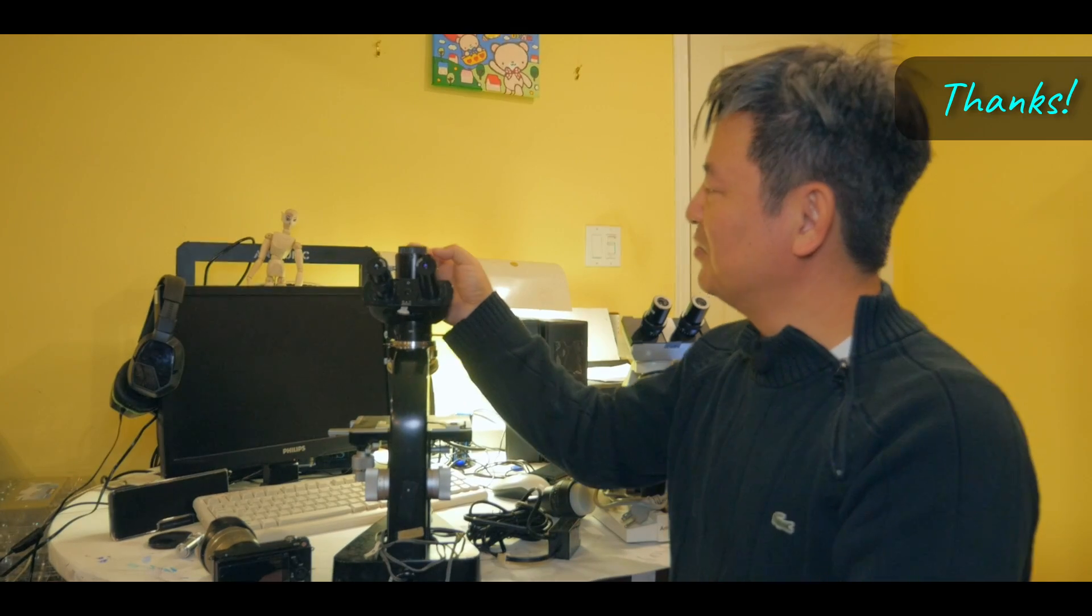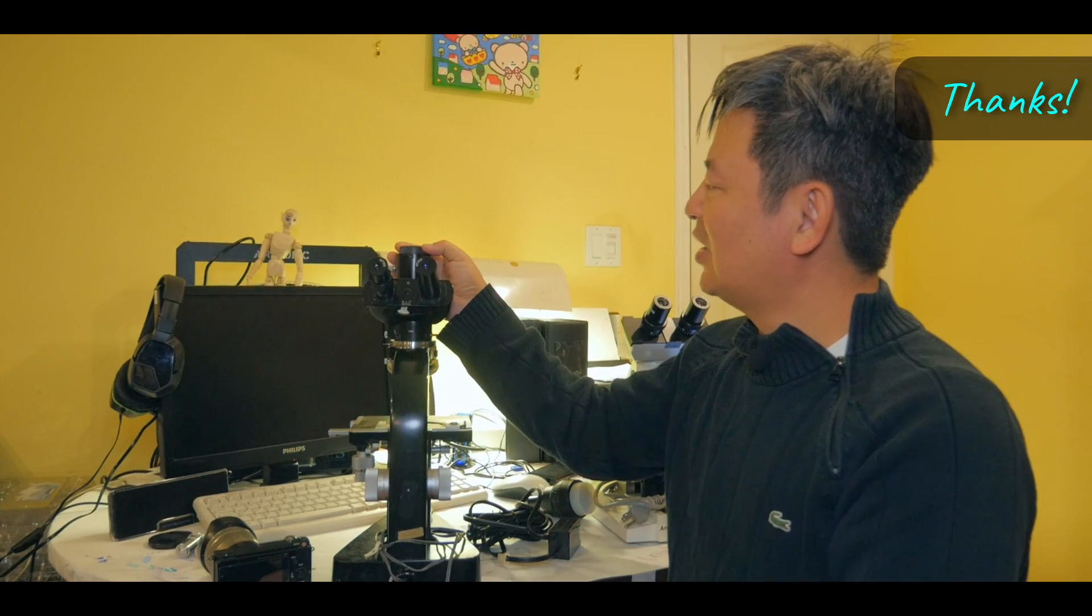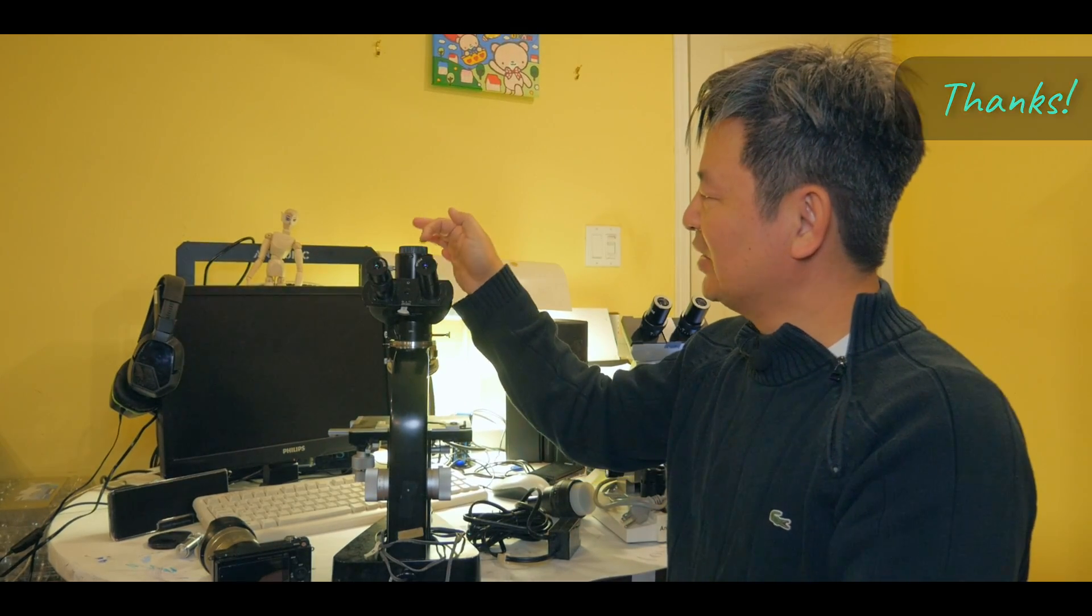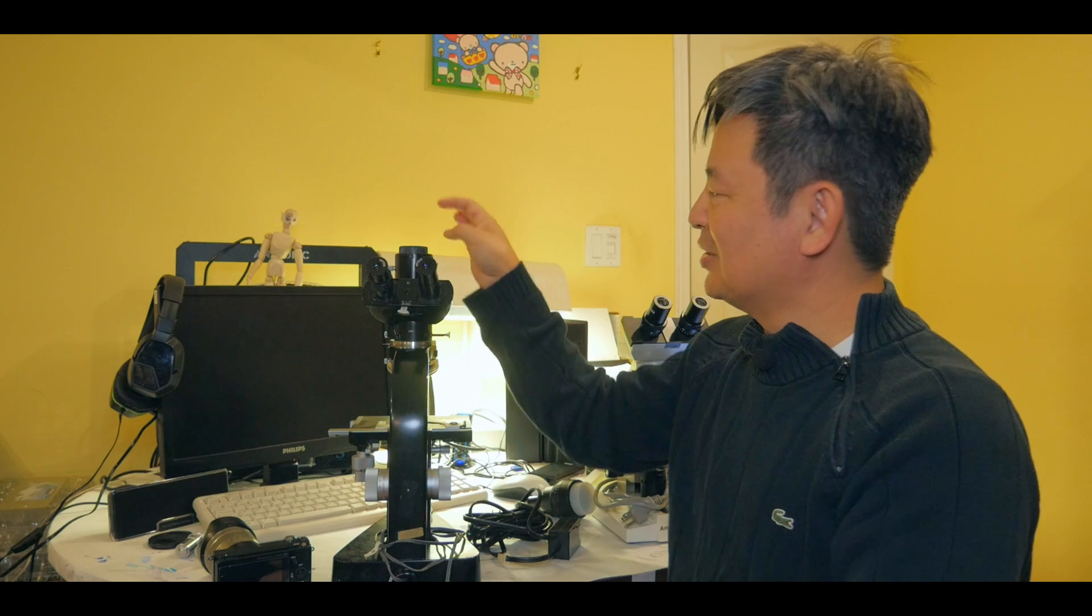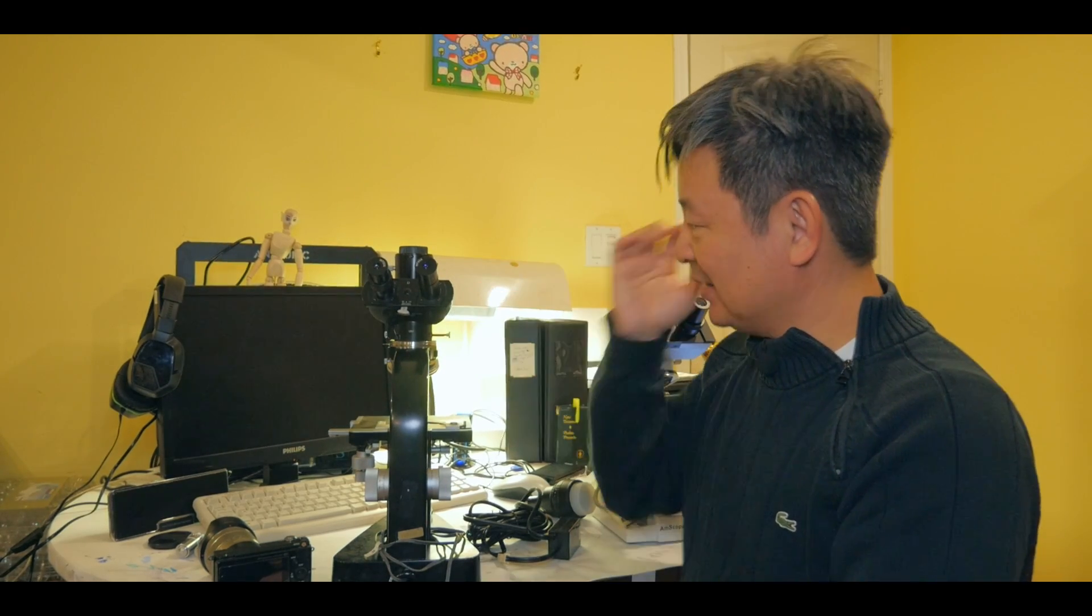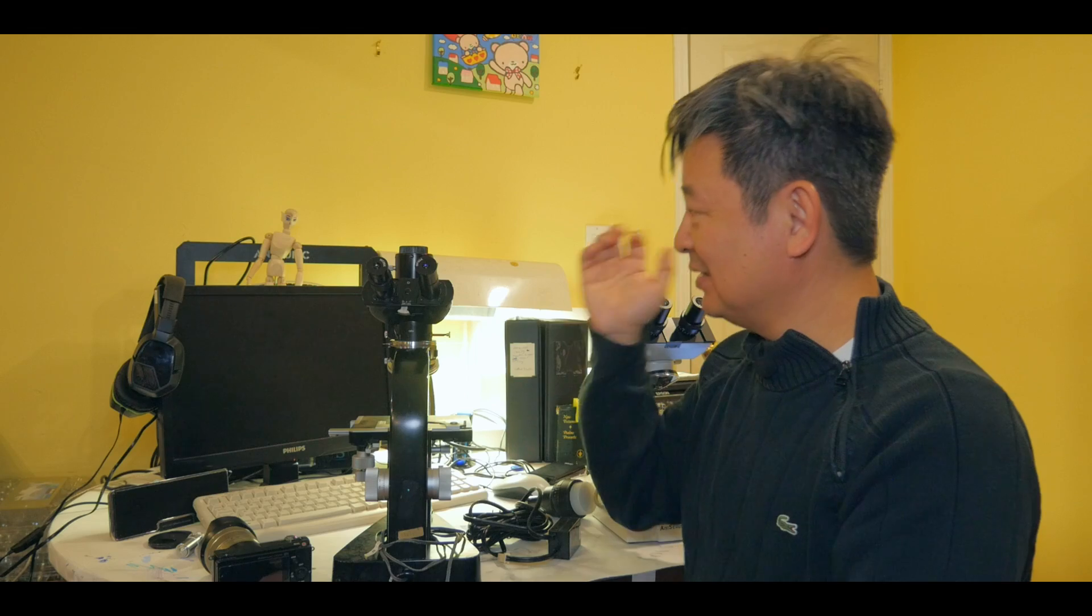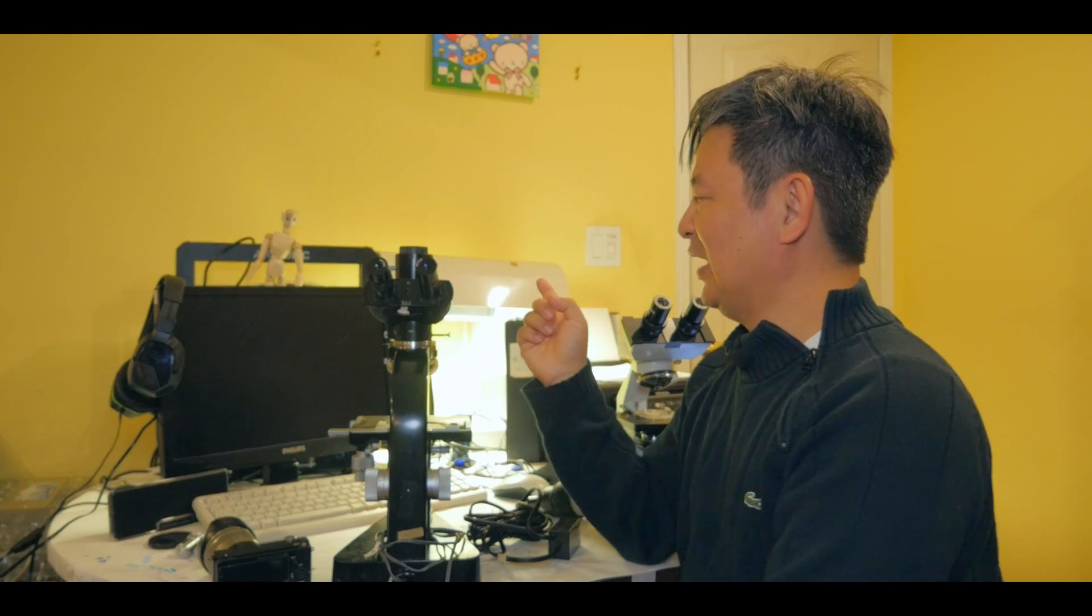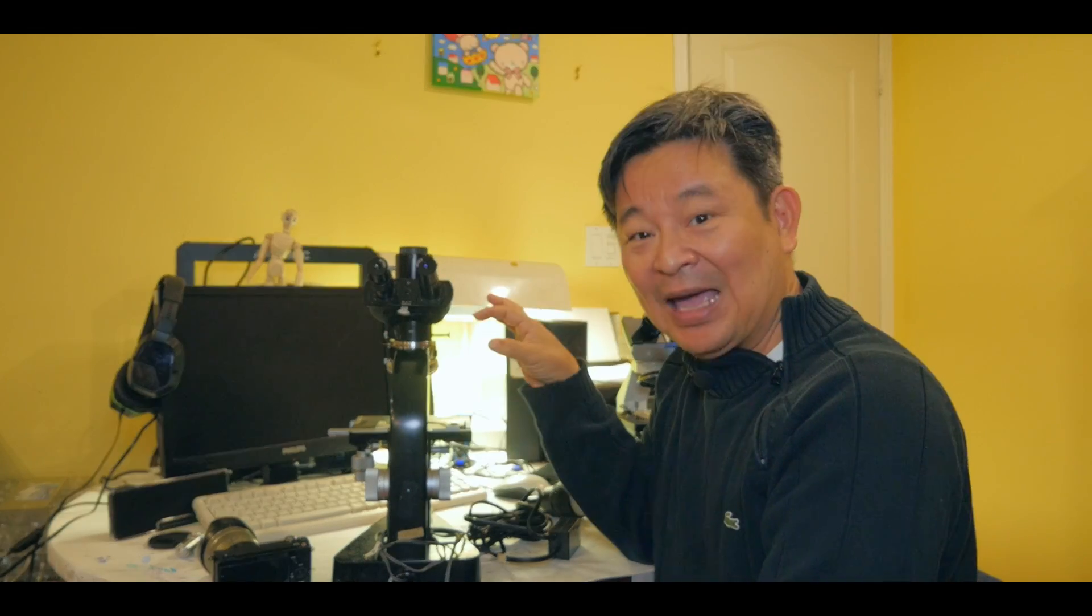What's interesting about this microscope is that there's a middle ocular microscope right here where you can actually put your camera in there. Now, originally when I bought it, it didn't have that ability to kind of connect to a camera, right? So I had to modify a bit of it. Actually, it's a very cheap way to do this. I'll show you in a minute.